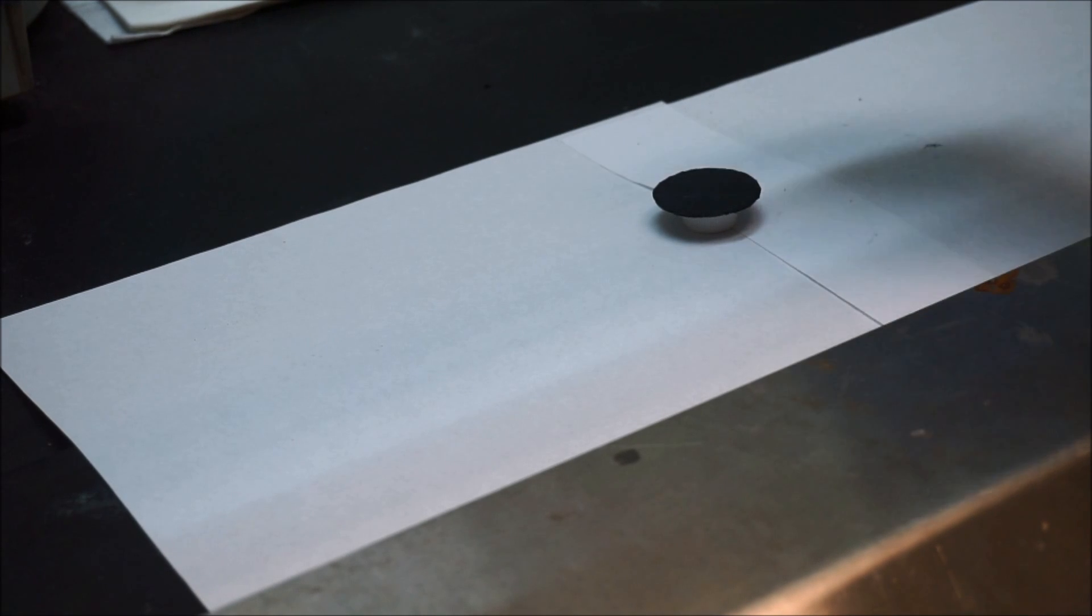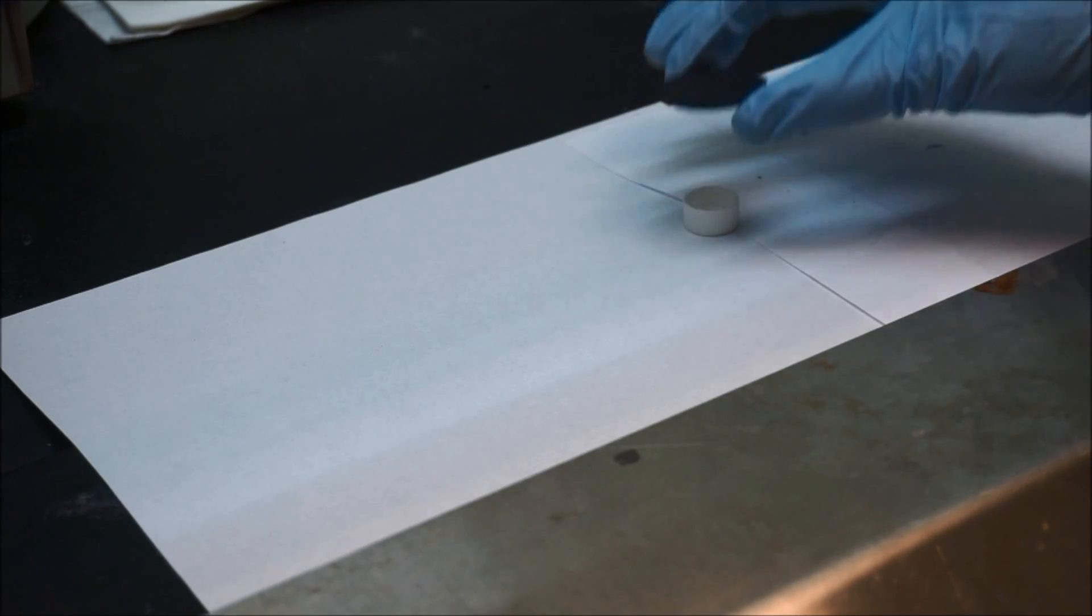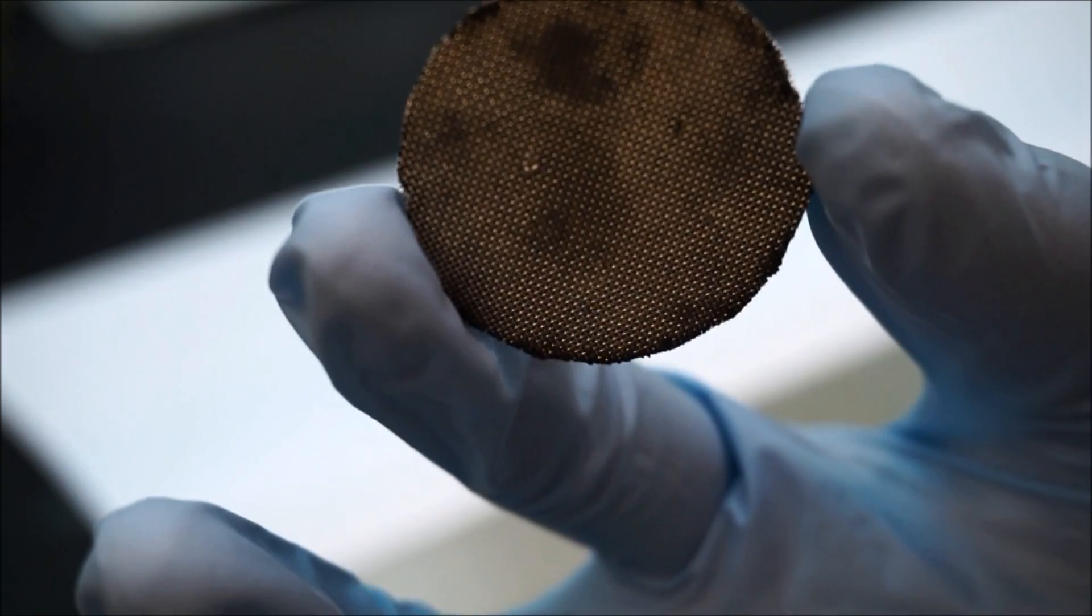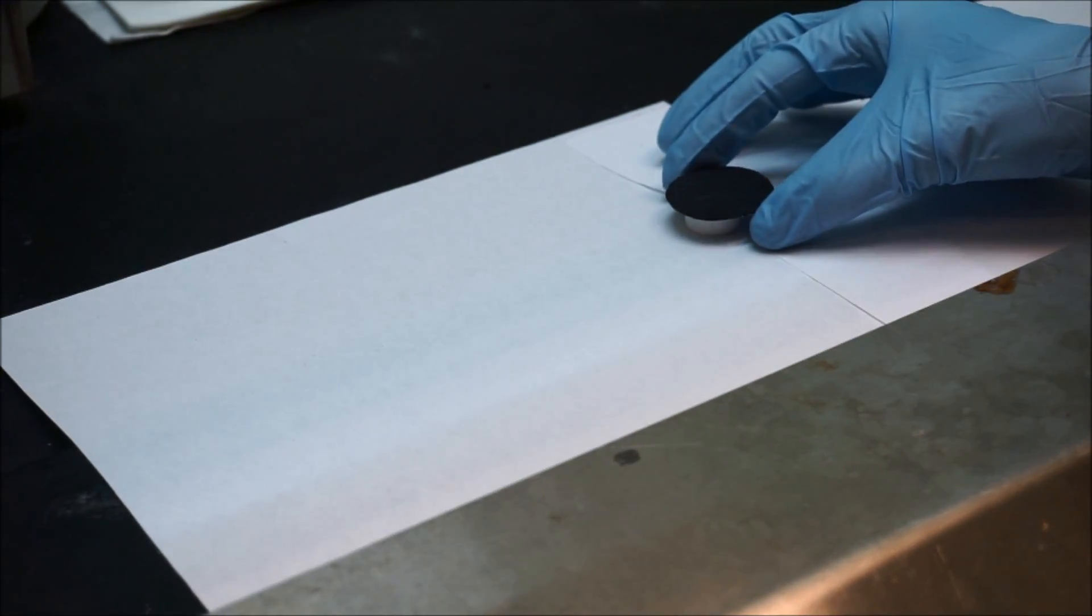After 8 hours, the cathode is already dry and we can use it in our MFCs. And remember to put the stainless steel side towards your solution. And thanks for your watching.